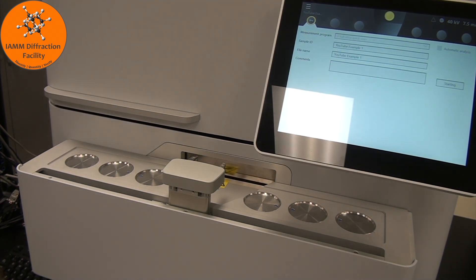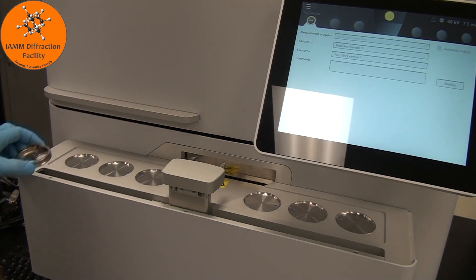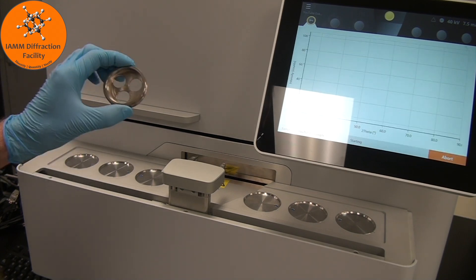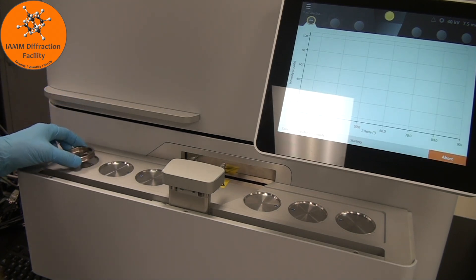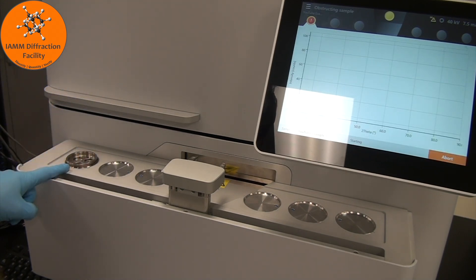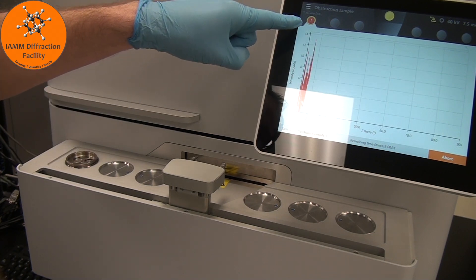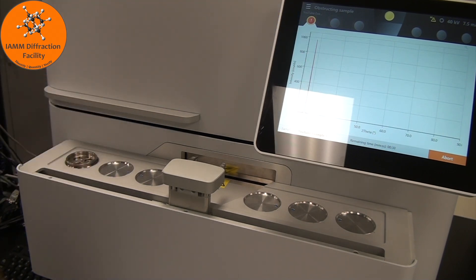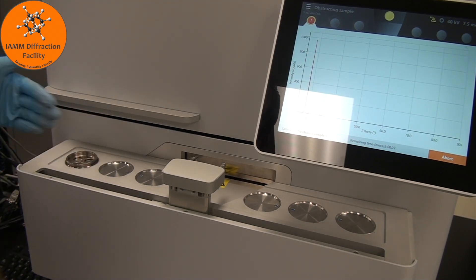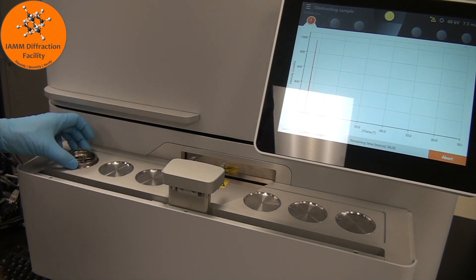One thing I want to point out is that if you took another sample and placed it in that same spot that the sample loaded from, you get a little red exclamation point in that sample holder position to let you know that you need to remove it right away.